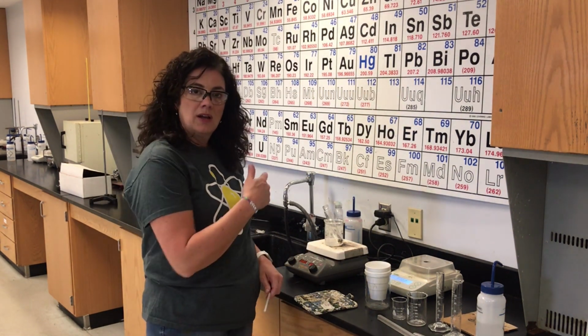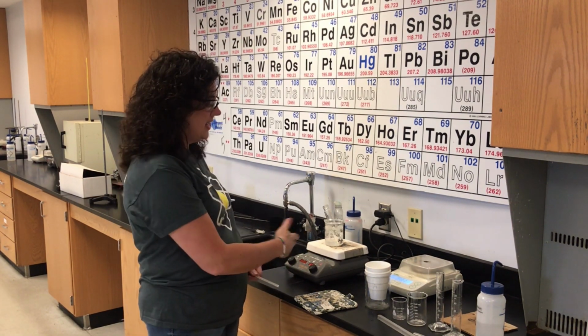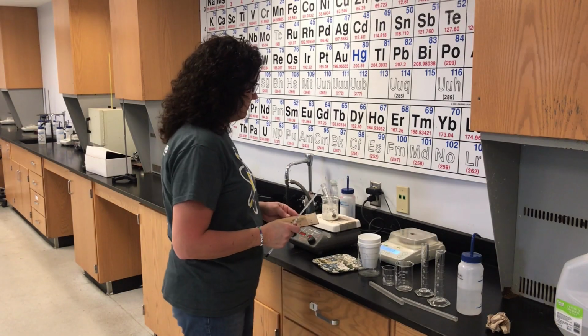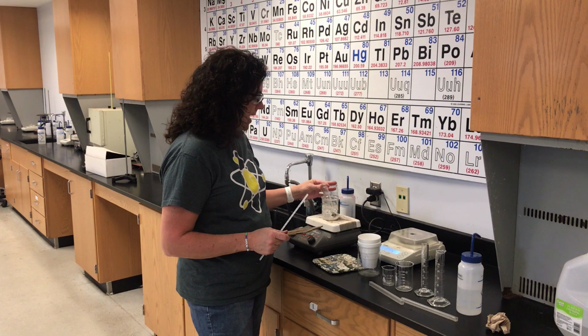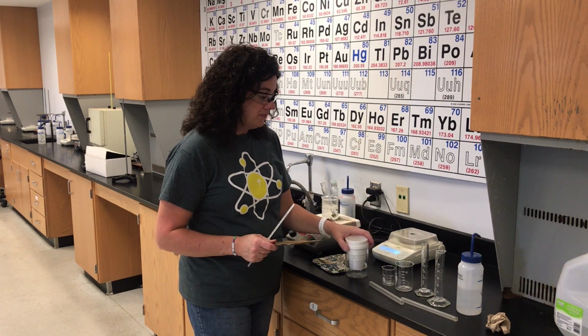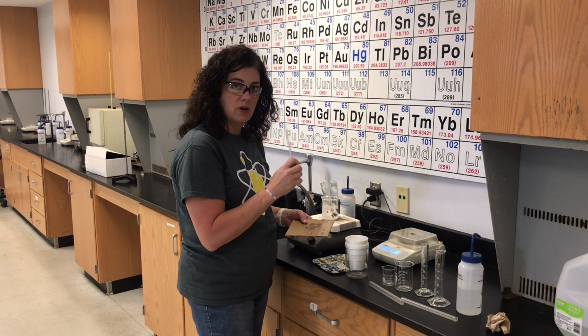Now, I'm not gonna sit here and just record this heating, but we're gonna let this continue heating. And so we're about to jump time. Okay, it's been heating plenty long. I'm going to take the metal carefully and quickly. I'm going to put the metal, just the metal, not the tube. I'm going to pour the metal into the calorimeter, and I'm going to measure the temperature that the water reaches.